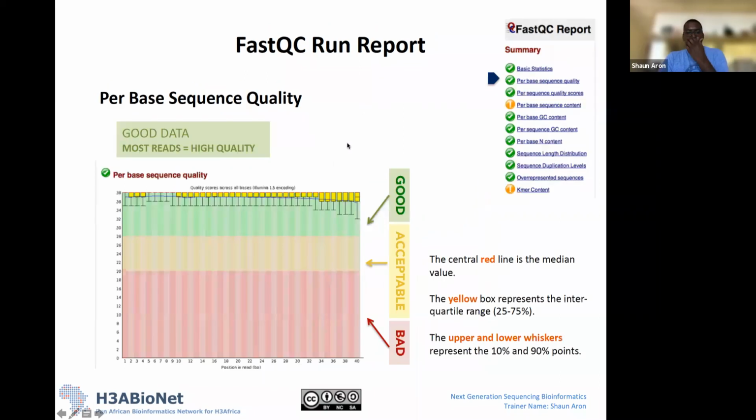Going back to good, acceptable, bad: this is color-coded to allow you to more easily visualize the quality of your data. Ideally, we always want to see our box and whisker plots falling into the green region. Your boxes might fall into the green region, and you might have some whiskers falling below that. That is fine. It depends on what you're accepting as high quality data, and you might want to trim based on that. But essentially, we always want to see our quality scores in this green region.